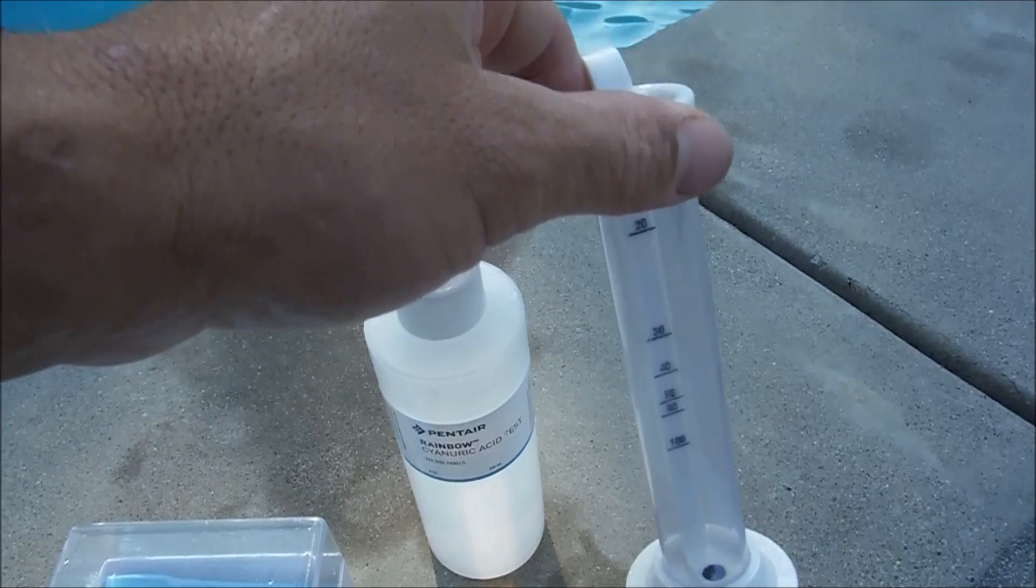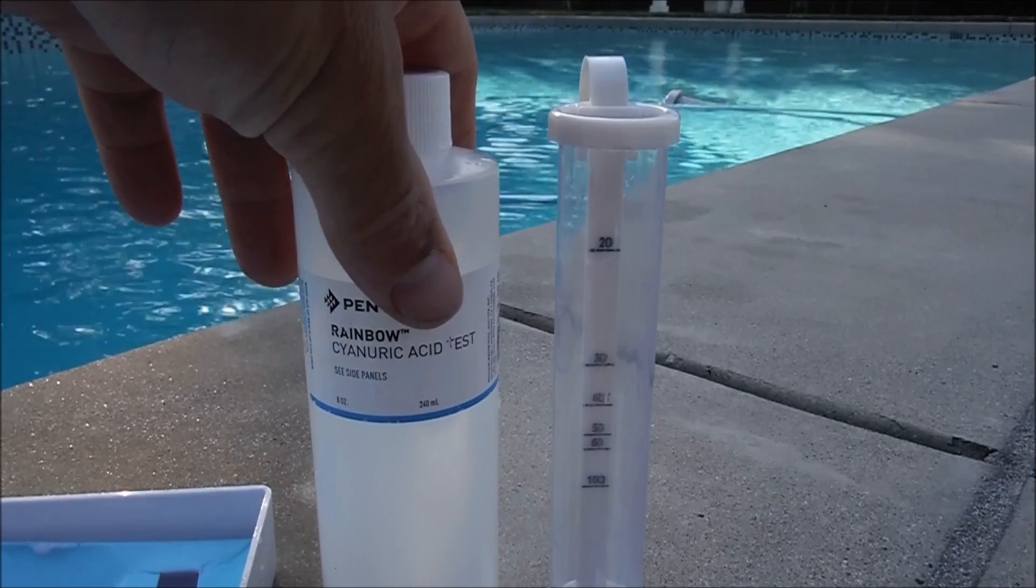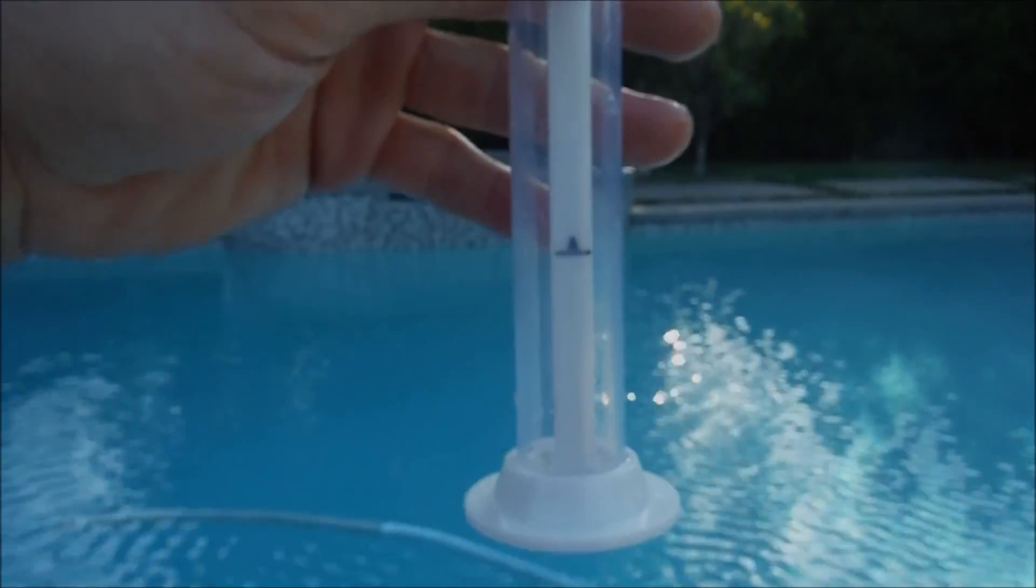Make sure you clean the test vial after every test. This is one of the most accurate testing methods for cyanuric acid levels. It's a turbidity test. It's a very easy test to use.